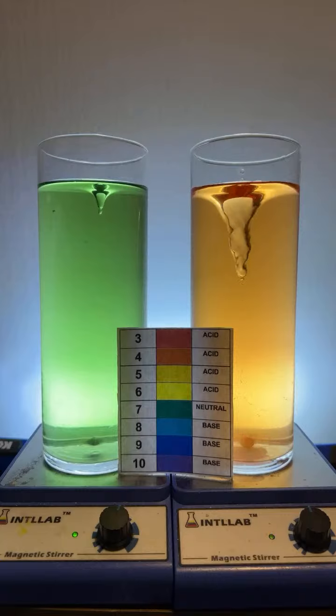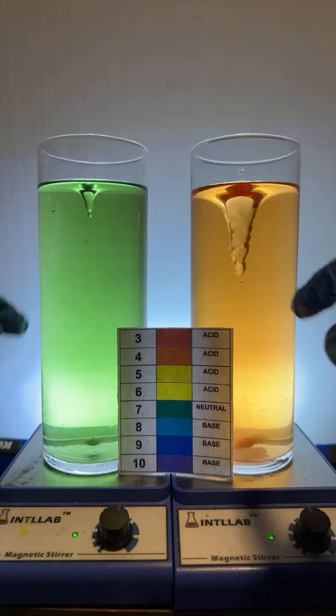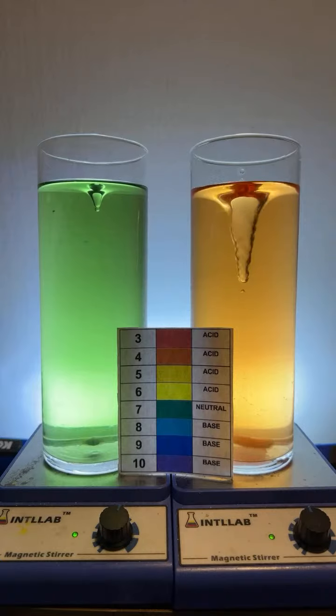I cannot make them colorless again. Thank you there, Musa. I appreciate that. Some glitter would look cool. We might do some glitter. But I think somebody asked for green on 1 and orange on 2. There you have it. Yeah, we might do some glitter experiments. We could do that later.